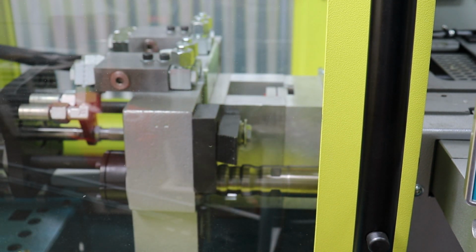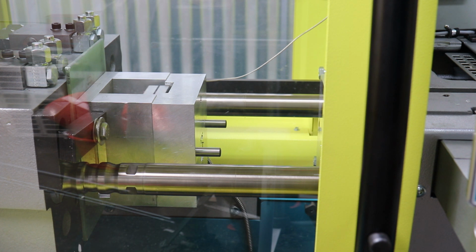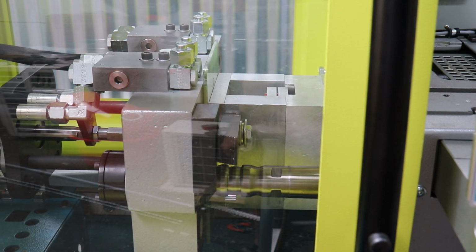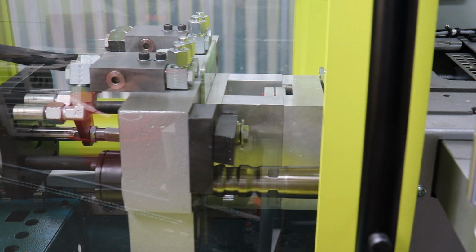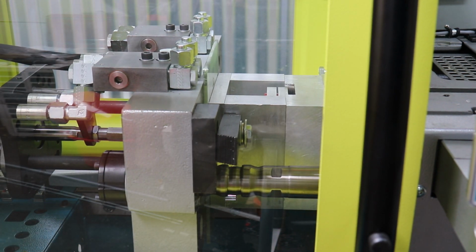You saw the molding machine pulled the ejector plate back automatically. Okay, I'm gonna try fully automatic mode. There we go. Yeah, it's real touchy. I think after this first trial, I'm gonna have to go and make the sprue ejector pin, the 3/16 center pin that's in line with the sprue, like 3 millimeters longer maybe. Well, it's ejecting, but you need to be able to have this thing work thousands of times without having a single hang up. And it doesn't look like it's gonna repeat 1,000 times ejecting without the part hanging up somewhere.